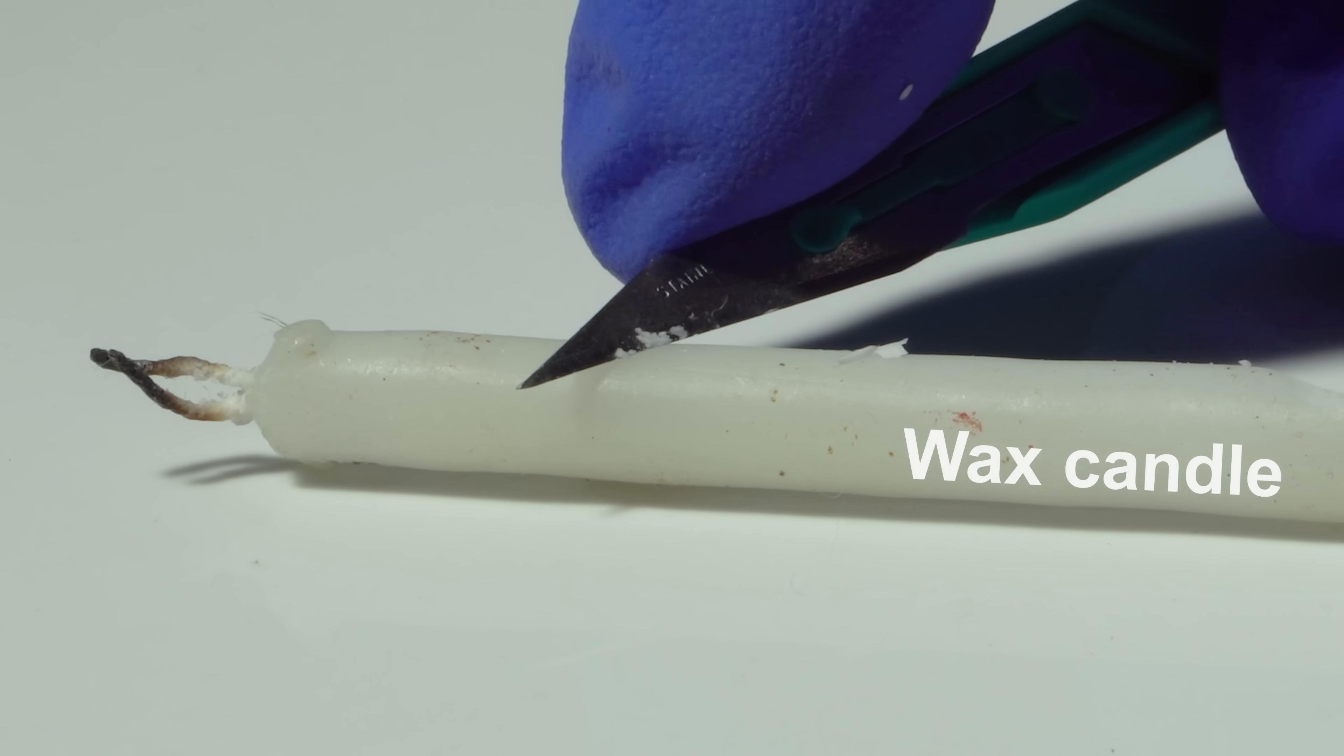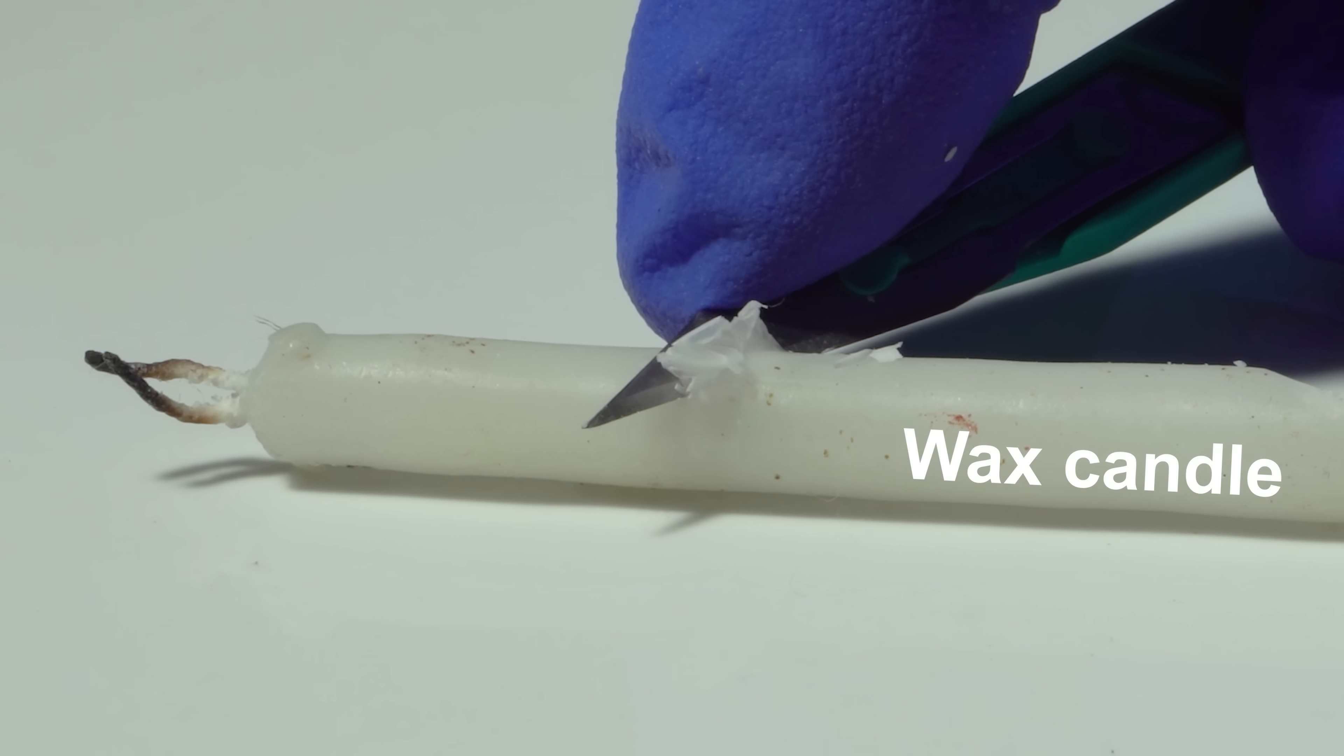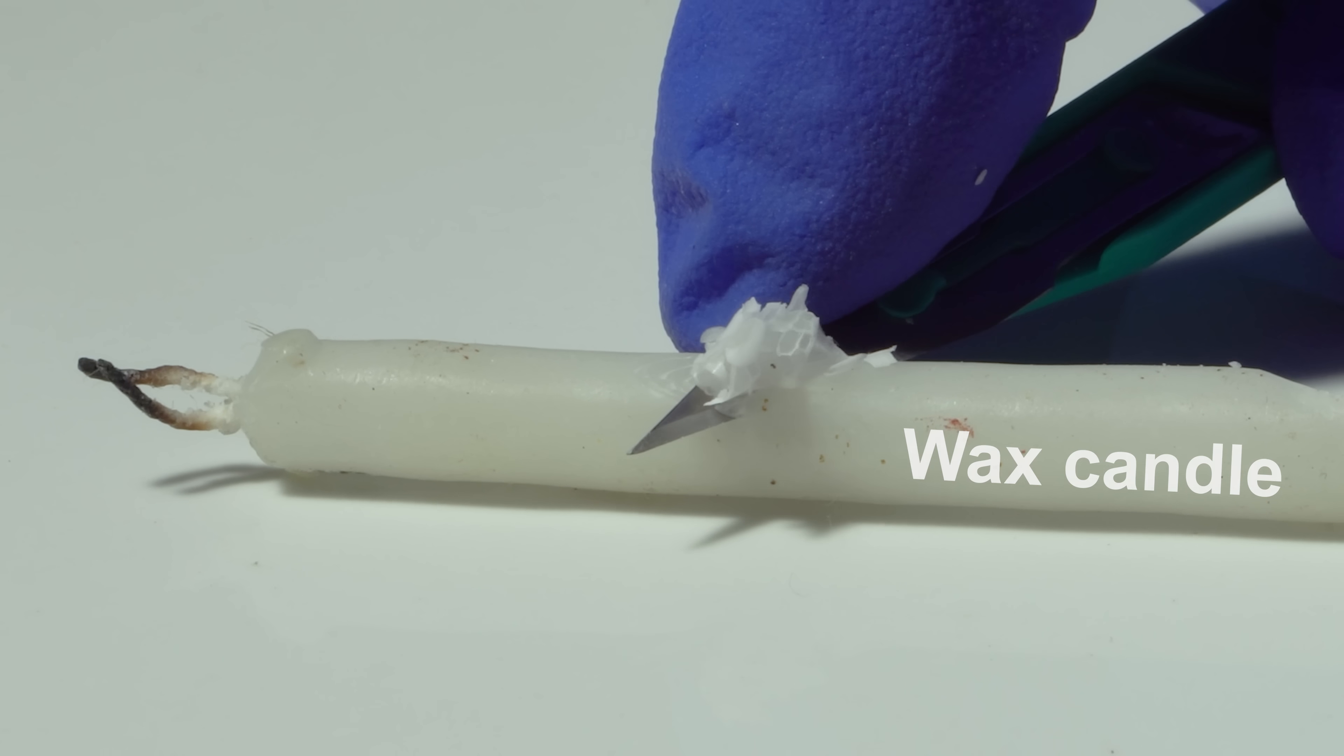Maybe that candle from the story was not a paraffin one after all, so I decided to repeat the experiment with wax.